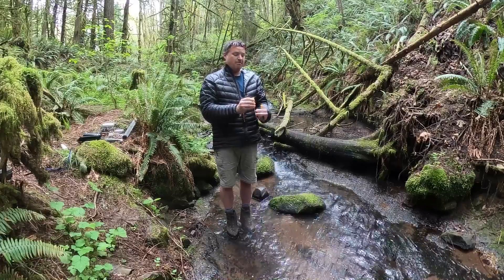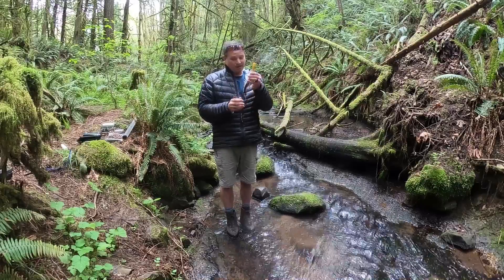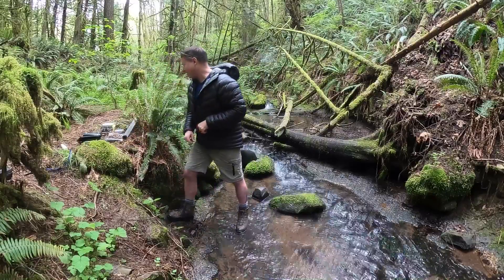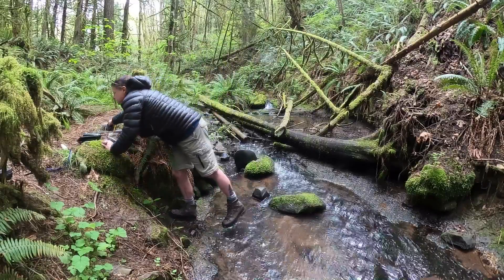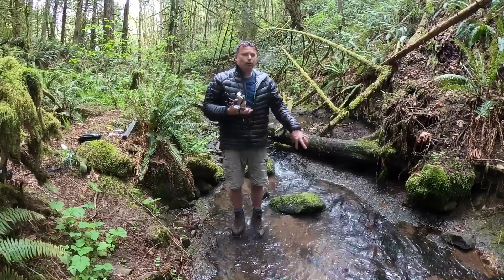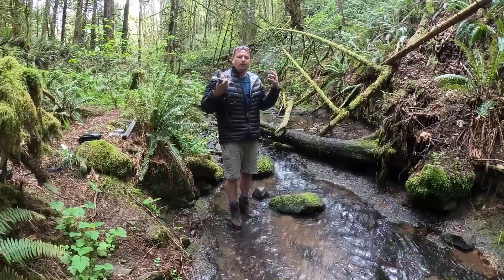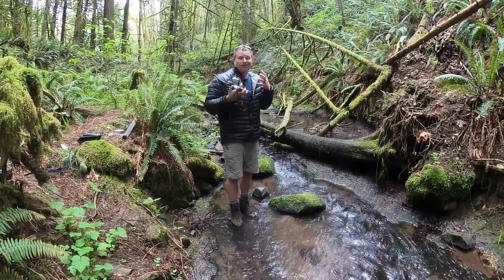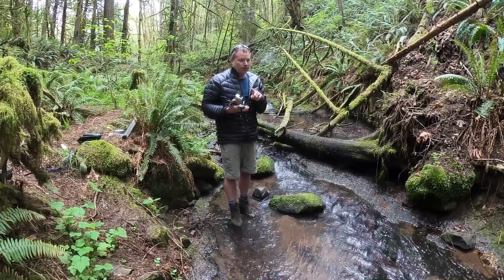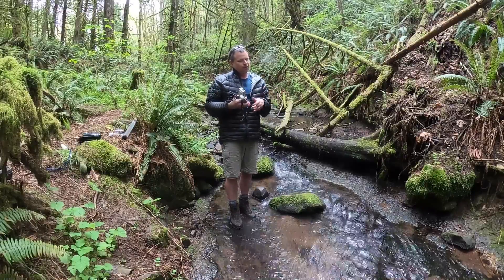So far, Little Buckner Creek today is doing pretty perfect: temperature, pH, and turbidity all check out. The last one is dissolved oxygen. Dissolved oxygen is not the bubbles you can see in the water — it's what fish and aquatic animals with gills absorb when they take water through their gills. It's not the little air bubbles we might think would be perfect for us to breathe. Dissolved oxygen we can't really see, so we have to test for it. Again, there's a great electronic device — very accurate — but really difficult to maintain and expensive.